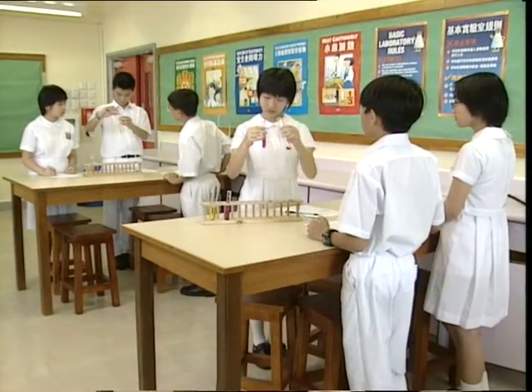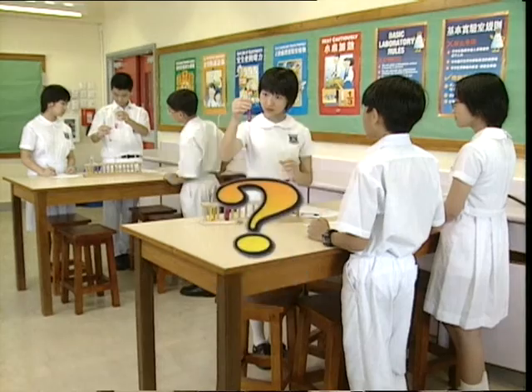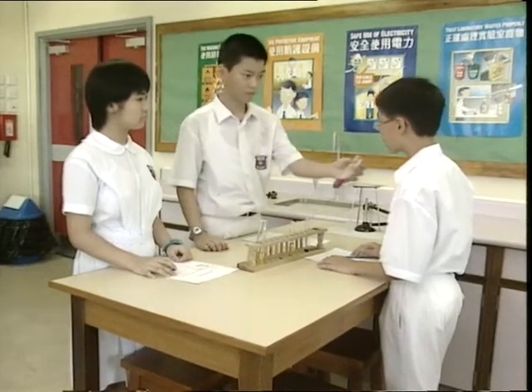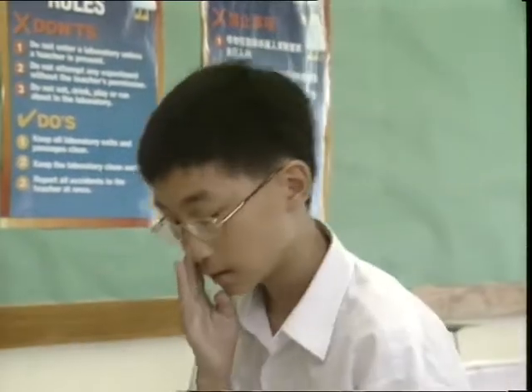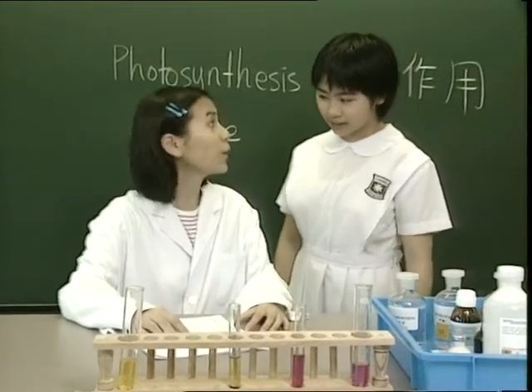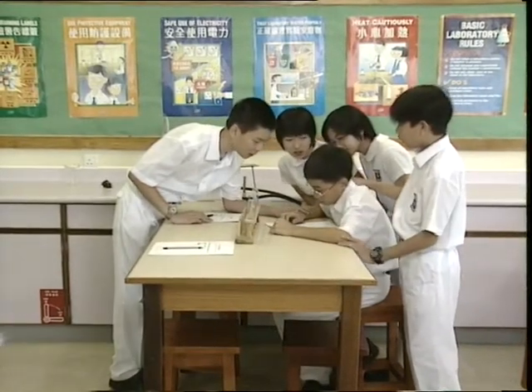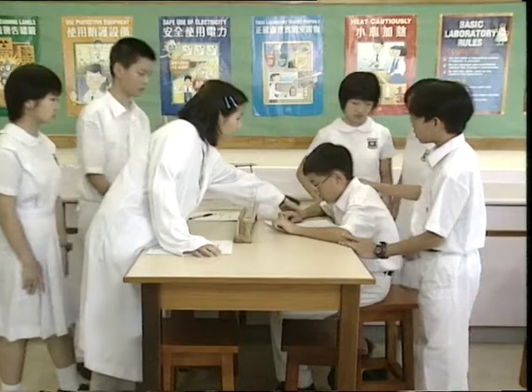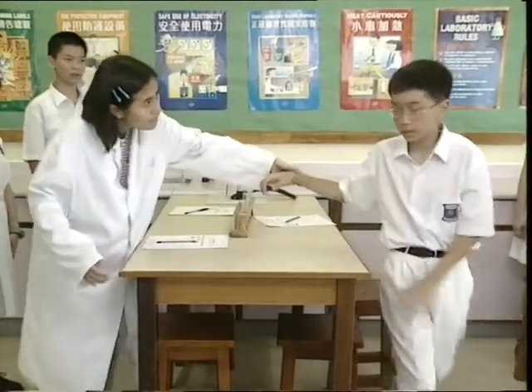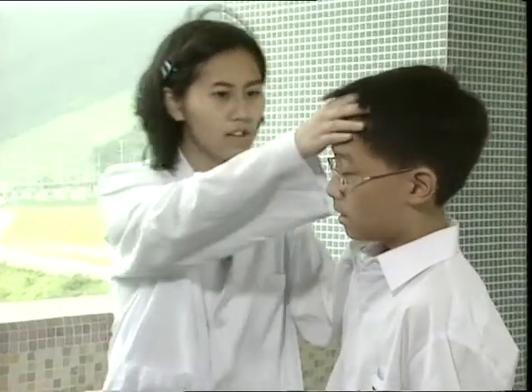If somebody breathes in certain gases and feels uncomfortable afterwards, what will you do? Very bad smell. I feel dizzy. You should inform the teacher immediately. Let me see. And the other students must stay away from the sick. Then, take the sick student to an open area so that he can inhale some fresh air and receive initial treatment.